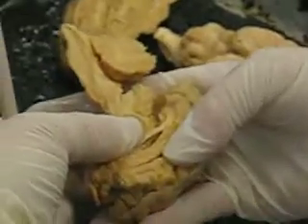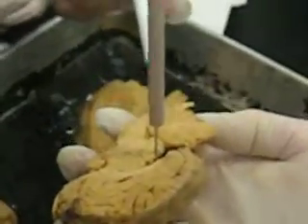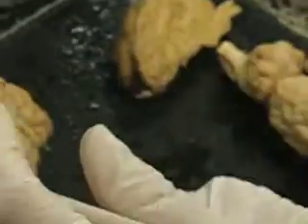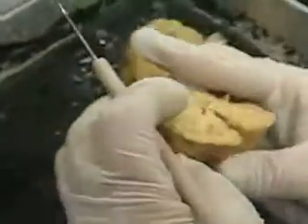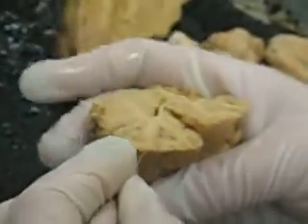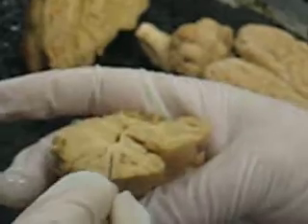Okay. And where's the third ventricle again? Got it right in here. Okay, then this is the fourth one. All right, saw the fornix earlier. Fornix right down there. Gray matter and white matter. Gray matter to the outside. It's darker, and there's white matter in there.